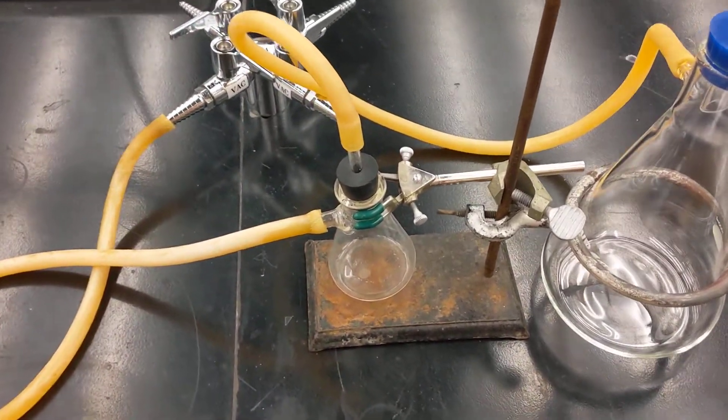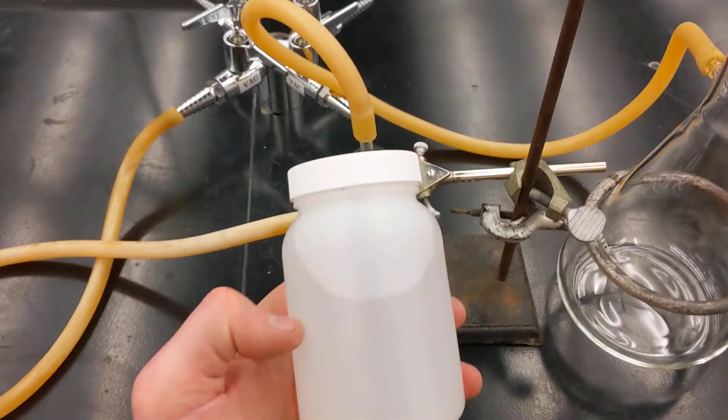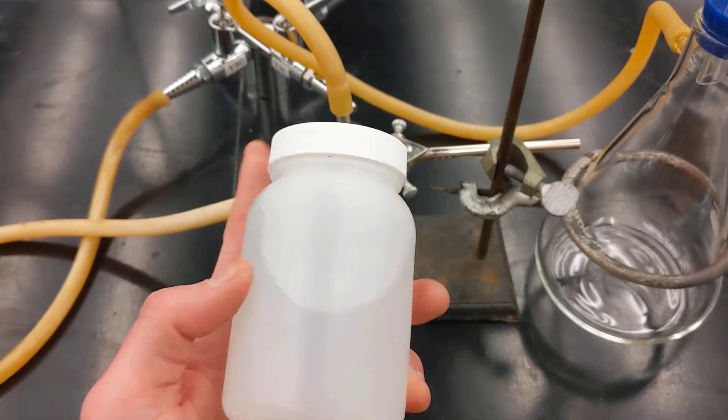All right, this is a quick video to walk you through how to sample larger volumes of field-sampled water, typically surface waters.